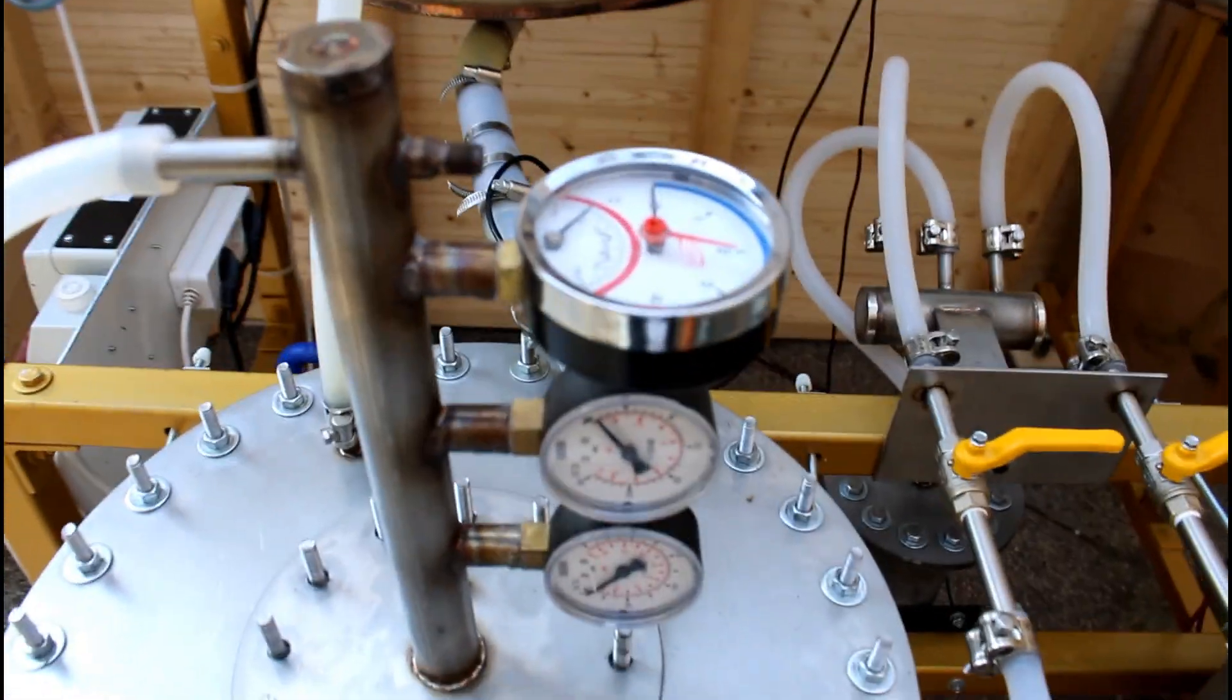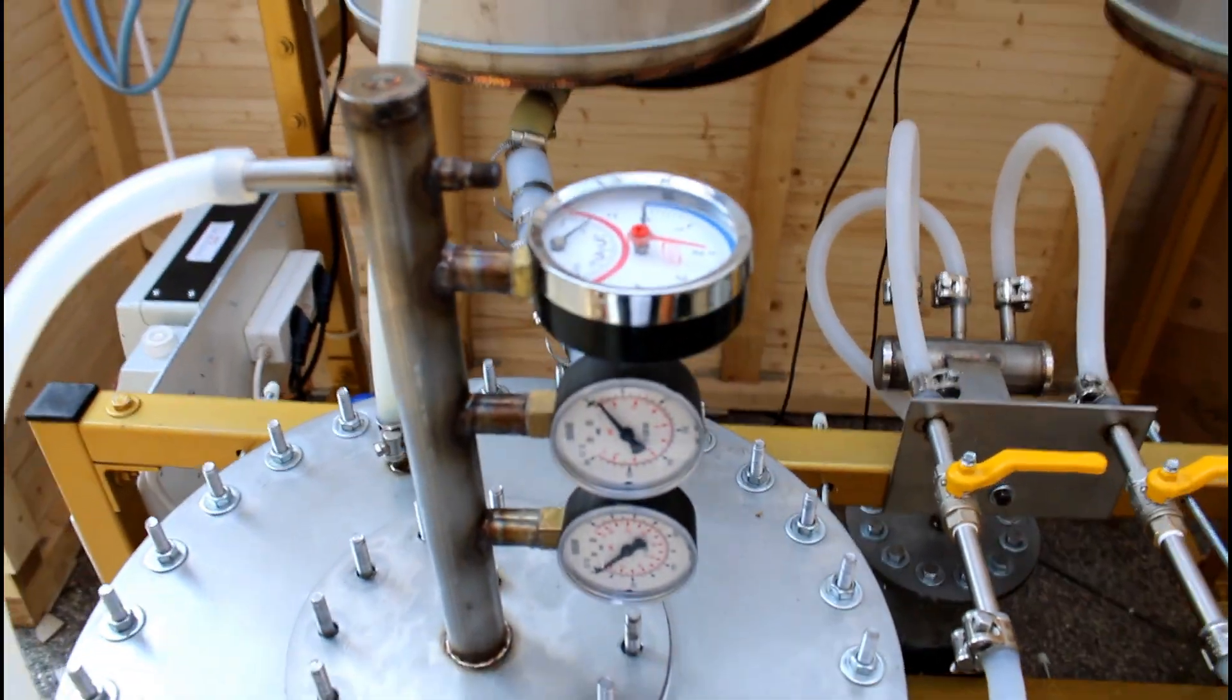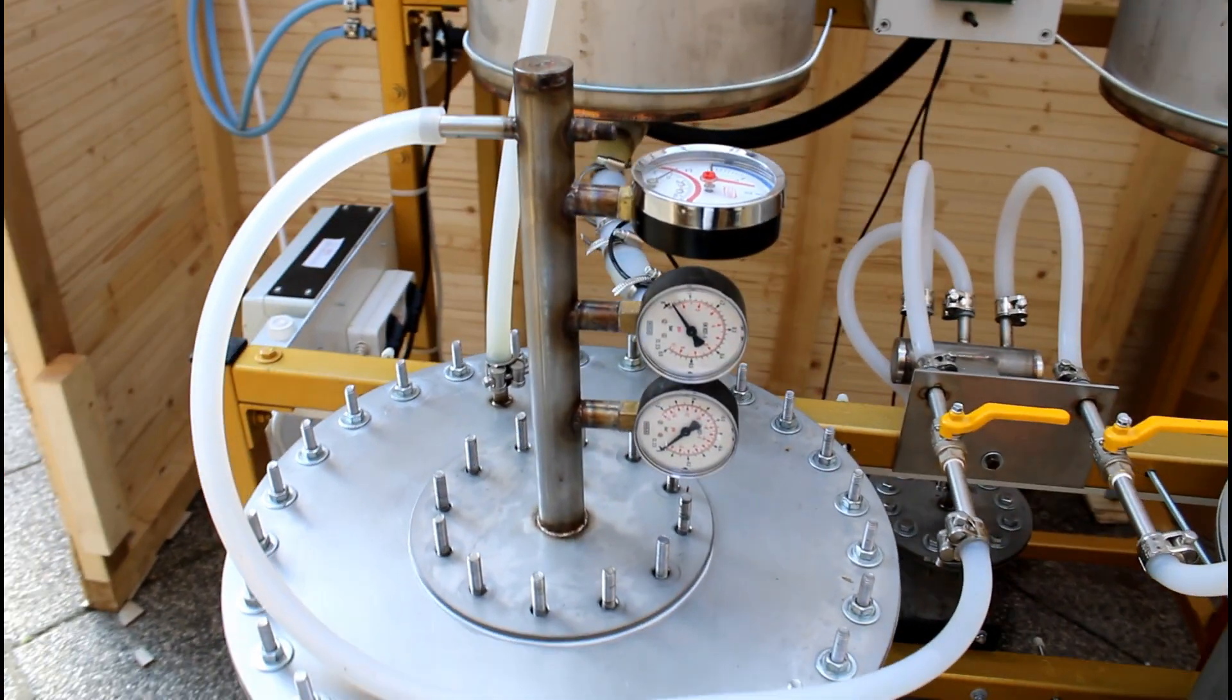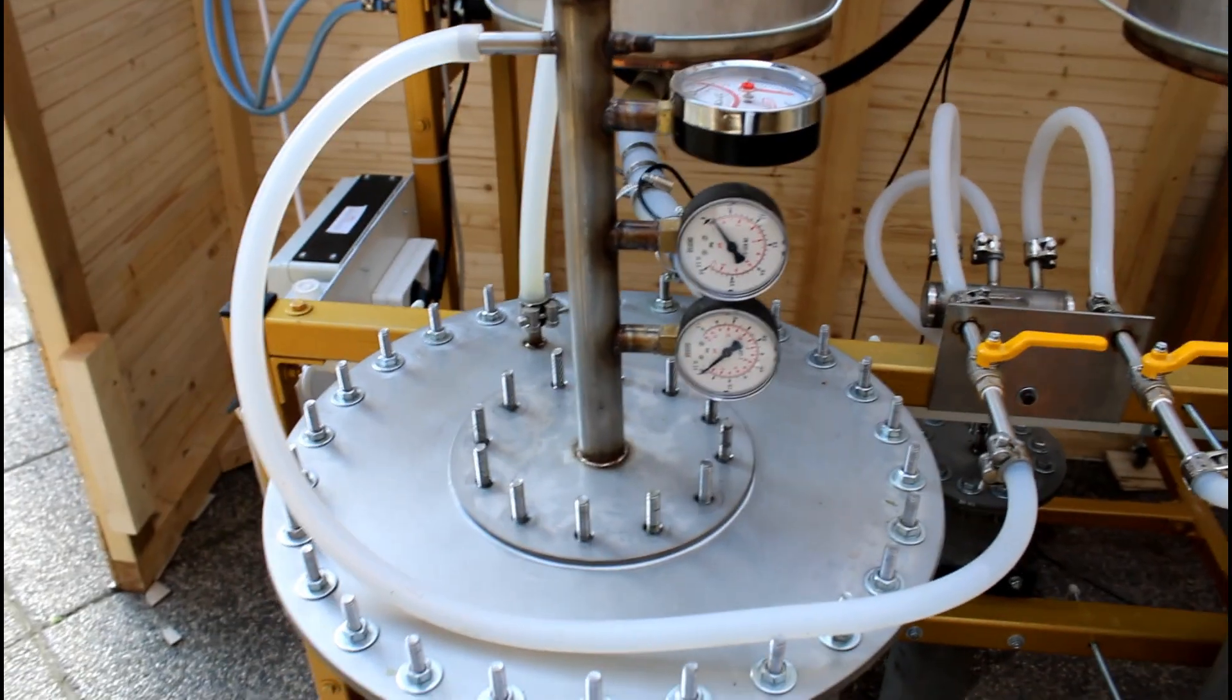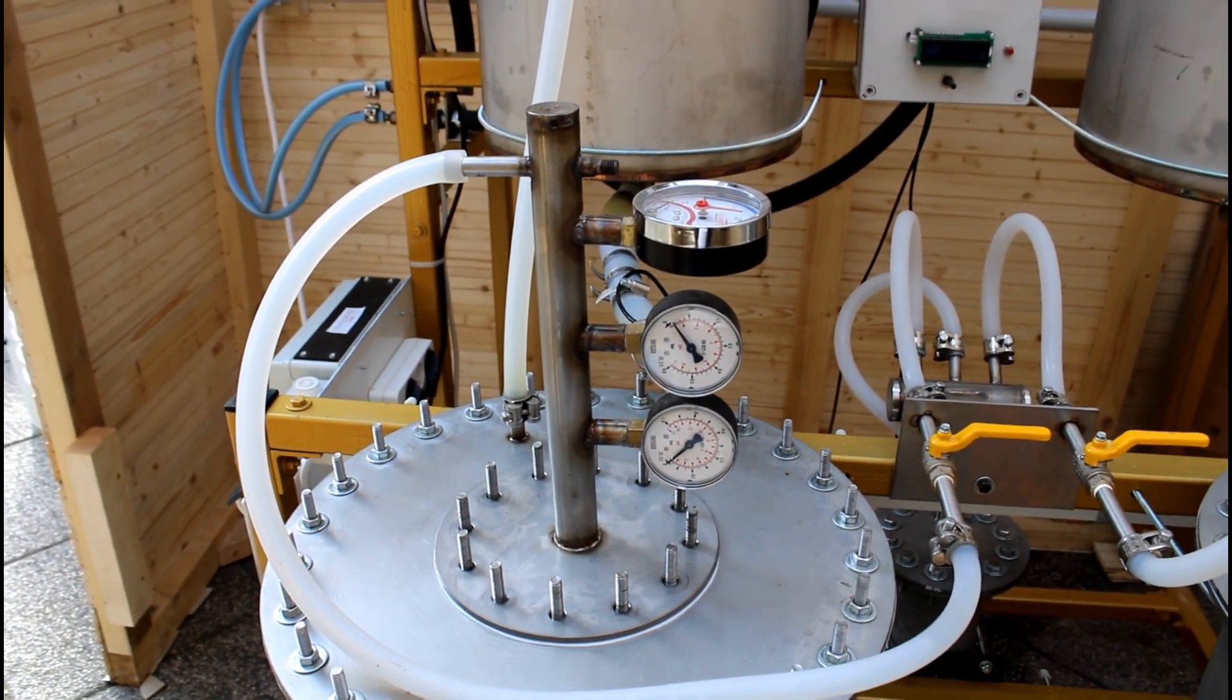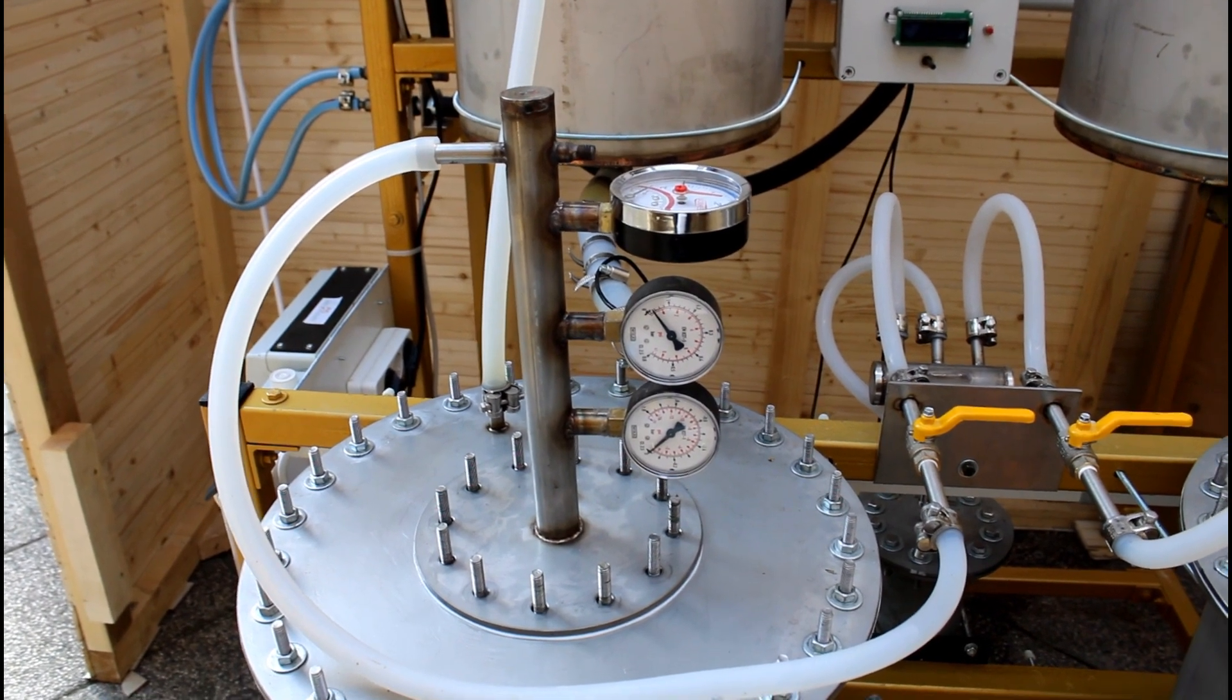And here I have a meter again. It shows me temperature and again bar. So they are pretty useful these meters to give me some values during the operation.